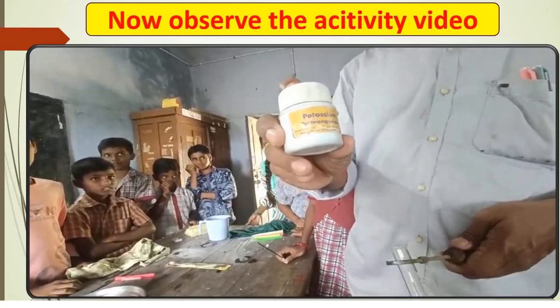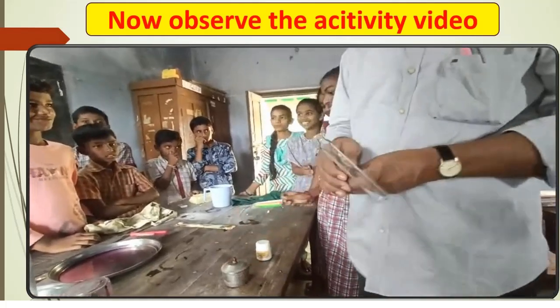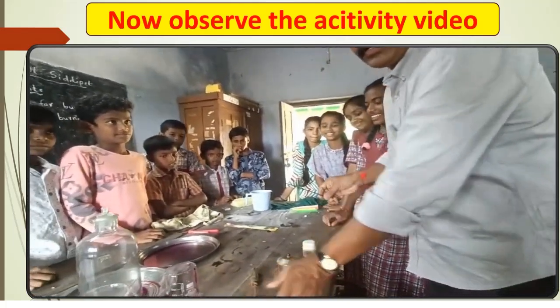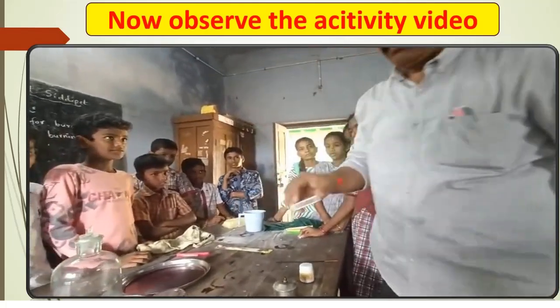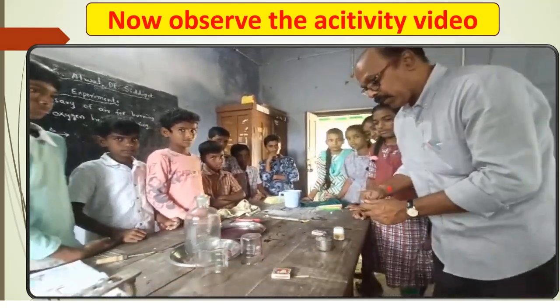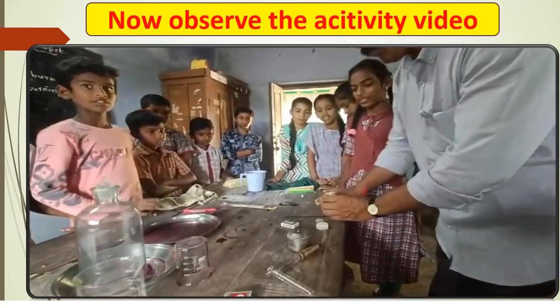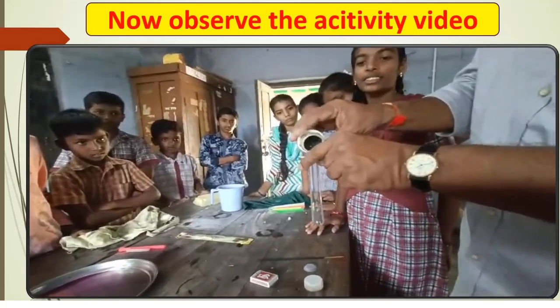Potassium permanganate, spirit lamp, test tube holder, agarbatti, match box. Hold the test tube with a test tube holder. Now take a small amount of potassium permanganate in the test tube.